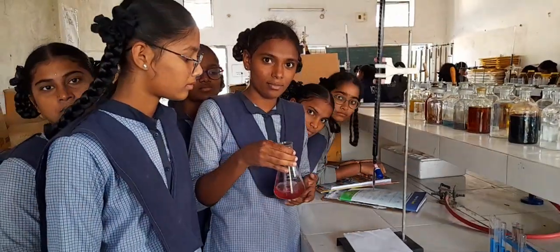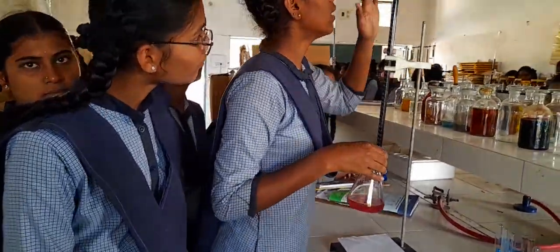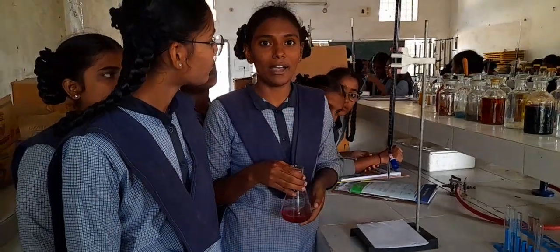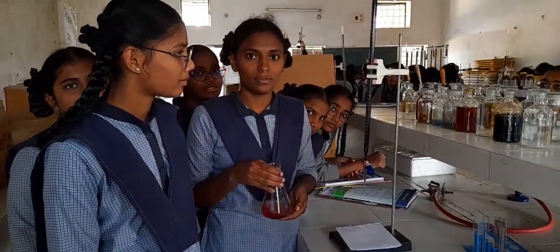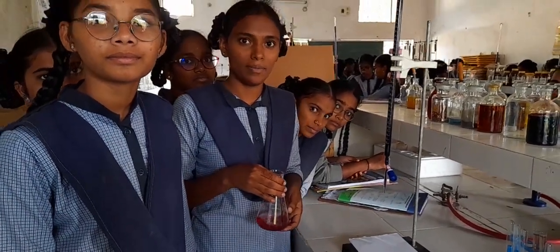Now the end point has turned pink. Pink, madam. Okay, what was your reading? 20.5, madam. Very good. You are very close to the value. Right. Now you can go with the next 2 readings. Okay. And next we can go for the calculation.